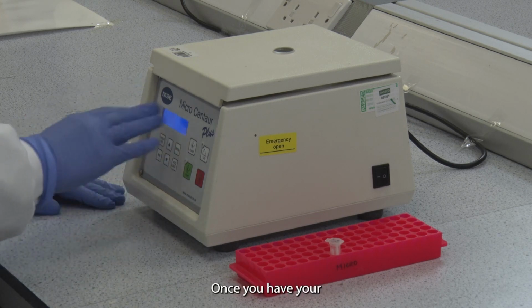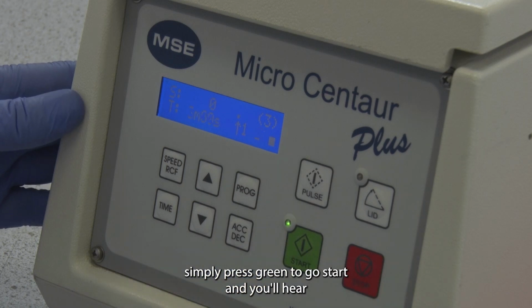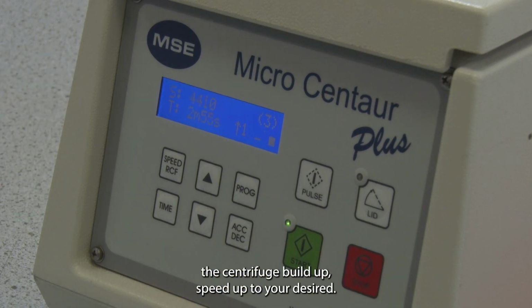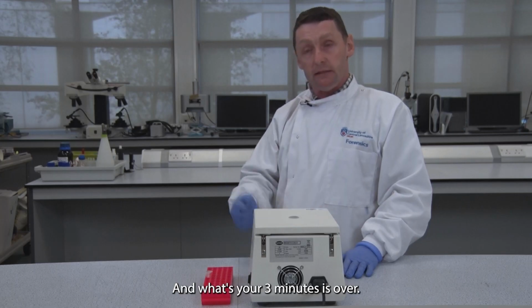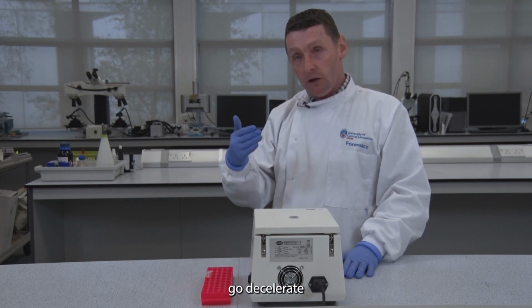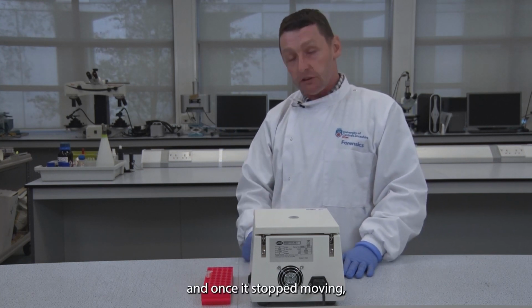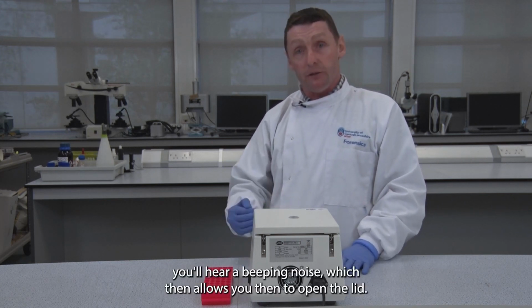Once you have your time and speed set, simply press green for go, start, and you'll hear the centrifuge build up speed up to your desired, in this case, 13,000 rotations per minute. And once your time is over, you will hear your centrifuge slowly decelerate, and once it stops moving you'll hear a beeping noise, which then allows you to open the lid.